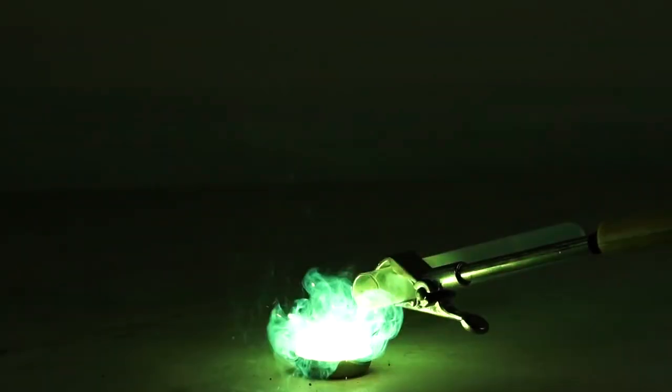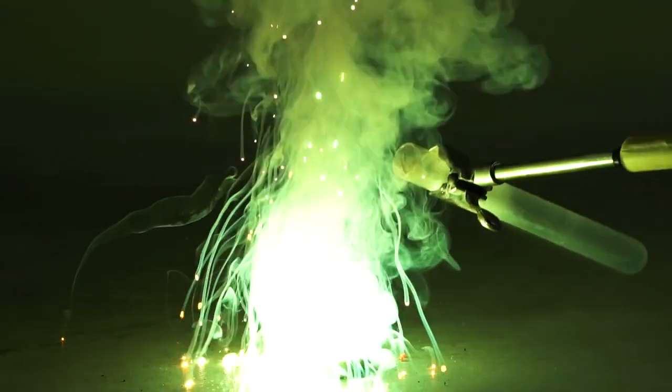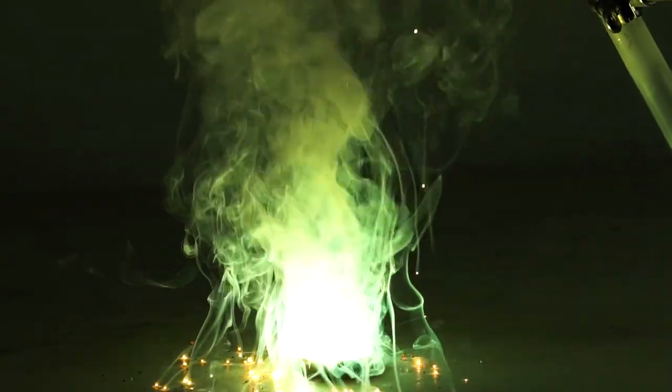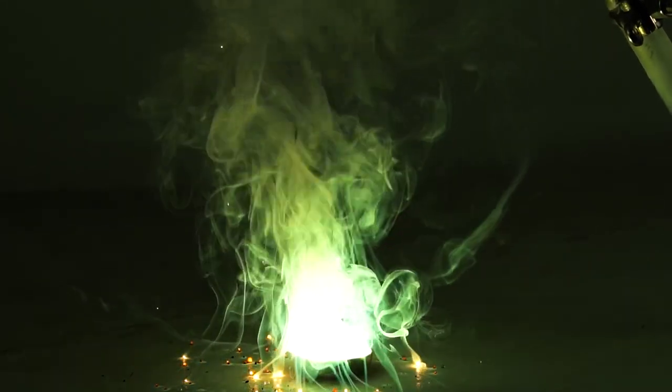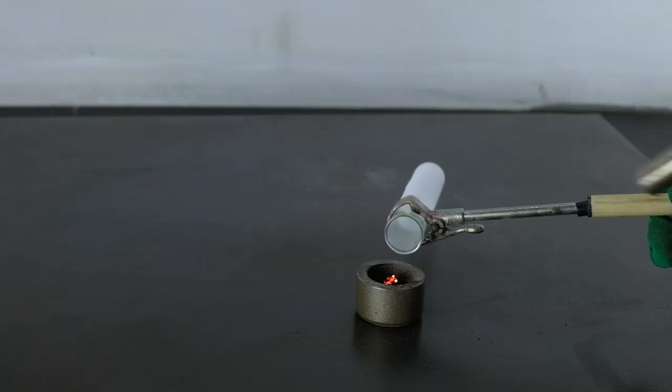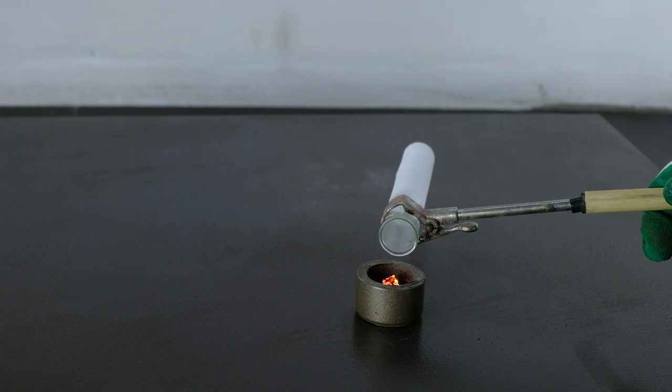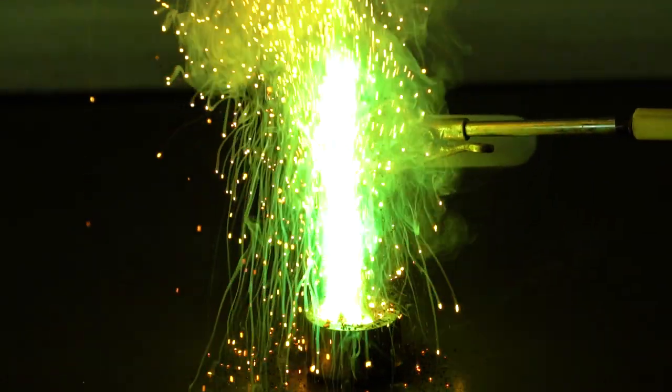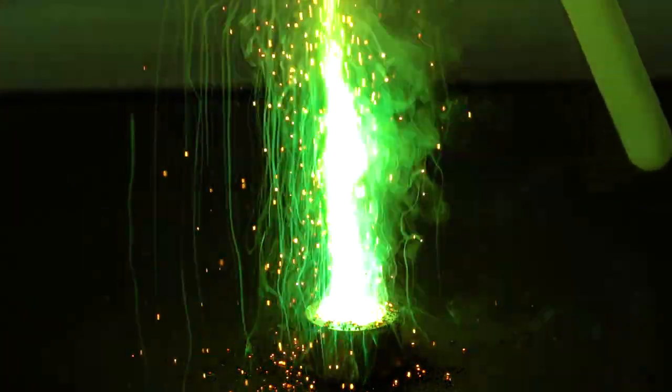In the video about burning non-metals in liquid oxygen, I showed you the reaction of combustion of boron in liquid oxygen. Let us compare it with the combustion reaction of boron in liquid nitrous oxide. What's going on here?